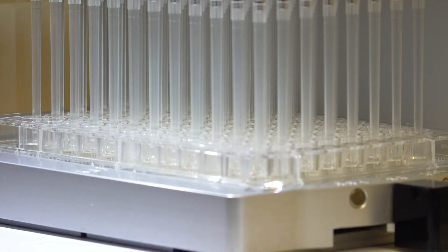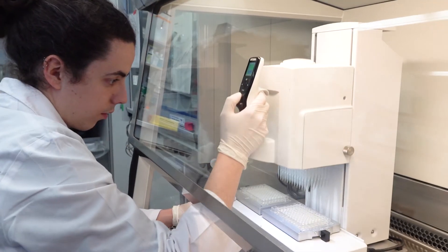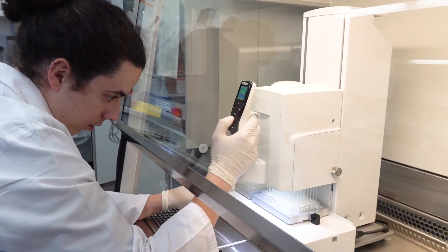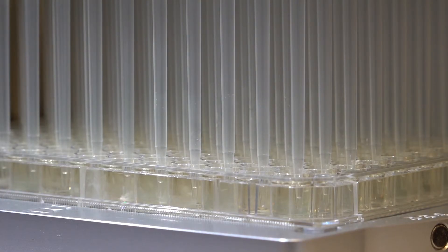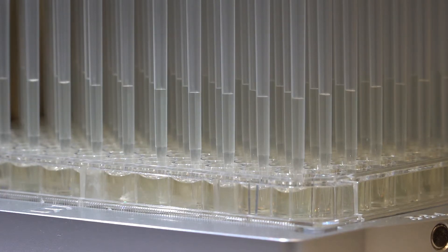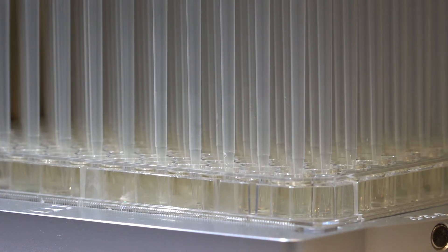I can do more complex things such as diluting the bacteria before starting another round of my evolution experiments, and the actual transfer to the fresh media where the bacteria will grow.